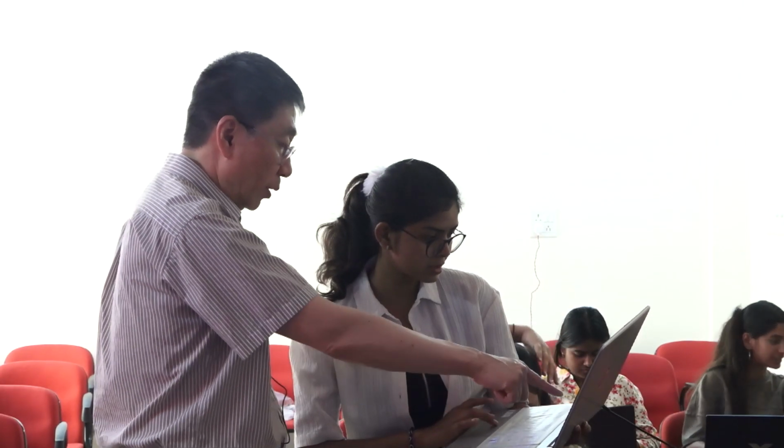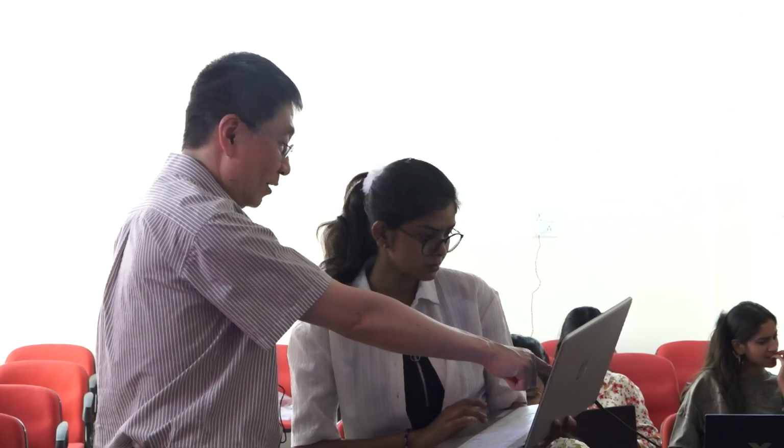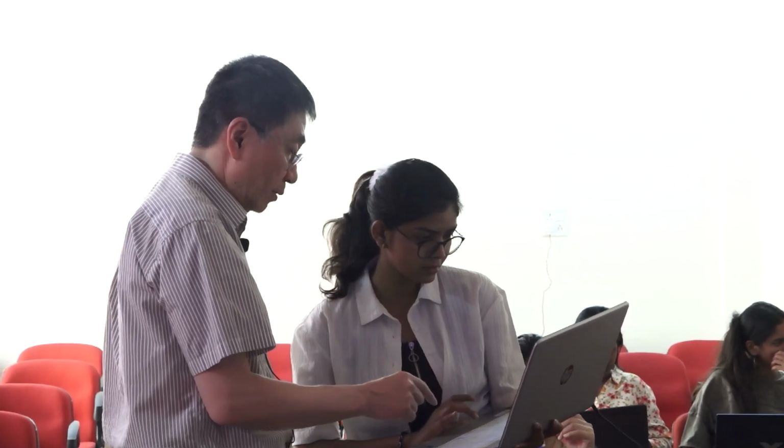Click on the atom. Any atom. No, you click twice. Single. Try again. Simple mutation. Simple Mutate only. No, you have both selected. Just click somewhere else. Okay, I don't know what's going to happen now. Let's see. Click on the alanine. No, that's valine. Click here. Okay, there you go. Select lysine. There you go. So then you should have it.